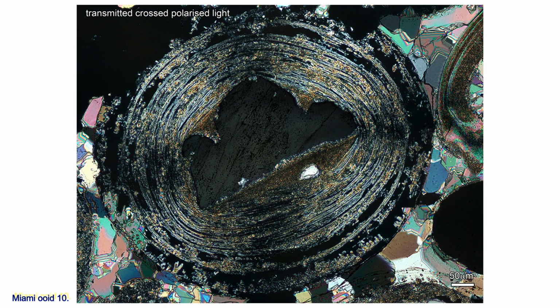Under crossed polars, the intergranular cement in the lower left corner of this image, with a pink and green birefringence colour, extends into the cortex pore by the red asterisk. This calcite nucleated on the base of the intergranular cement crystals and grew into cortex space once it had become a fluid-filled pore.